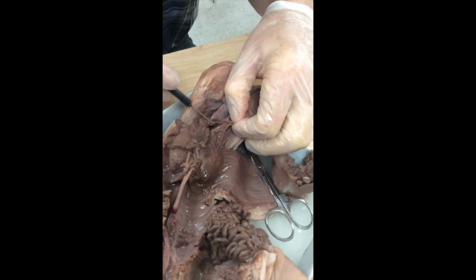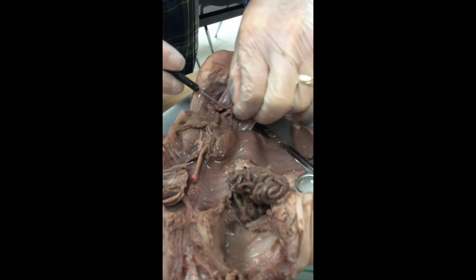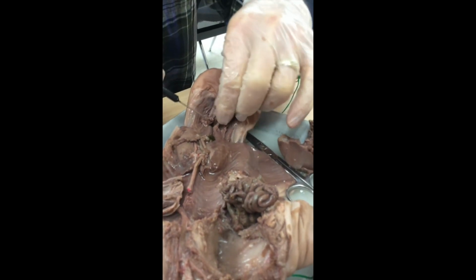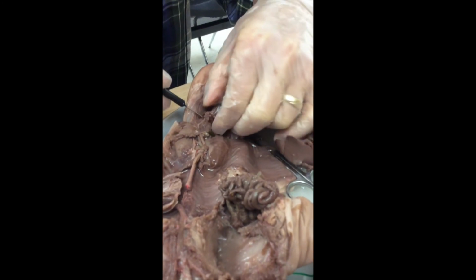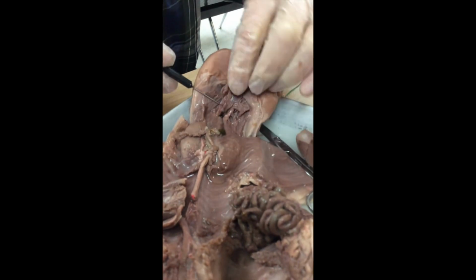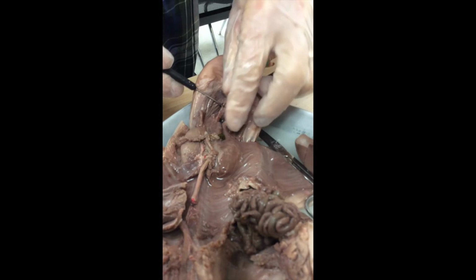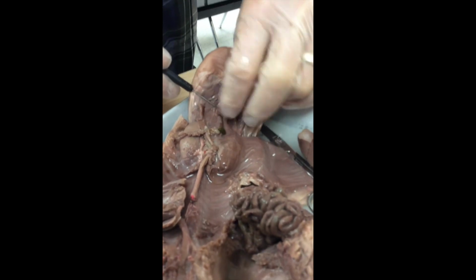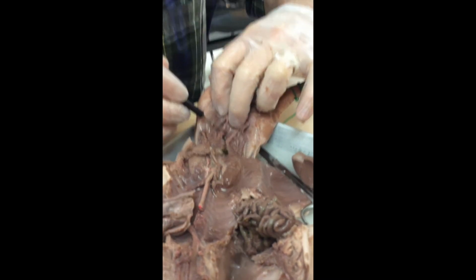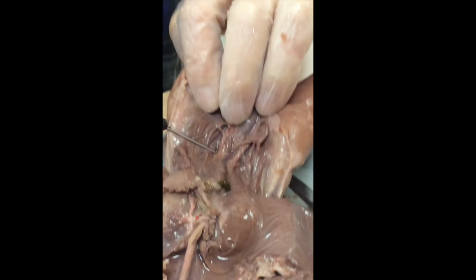Now, as I tease this tissue away, oh my goodness, looky, looky, we discover that we have pipes coming down through there. Again, there's an ovary right there. Of course, the uterus is going to attach to an exit pipe heading out there. That would be the vagina going out right there.